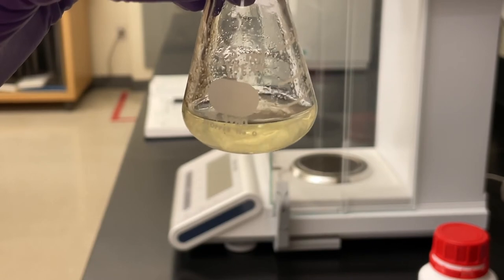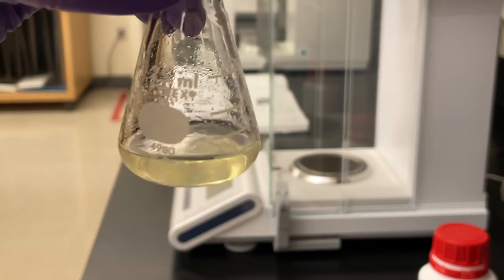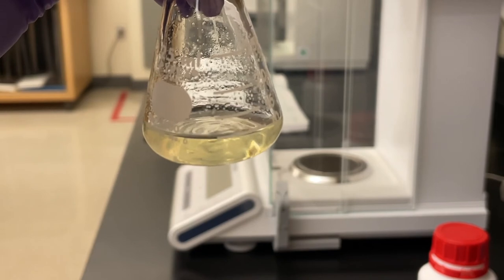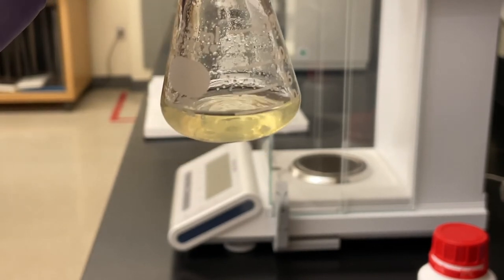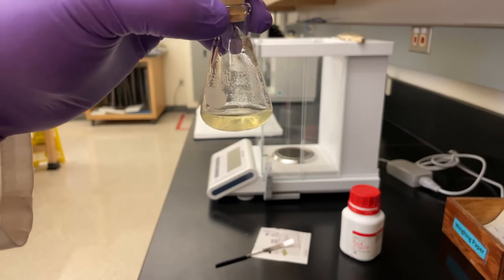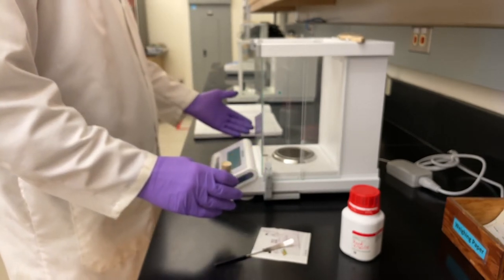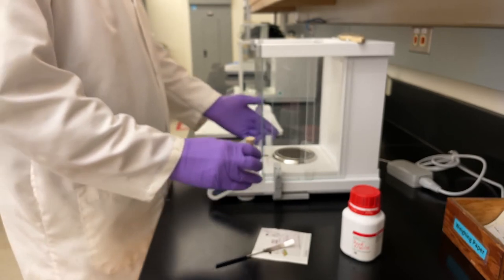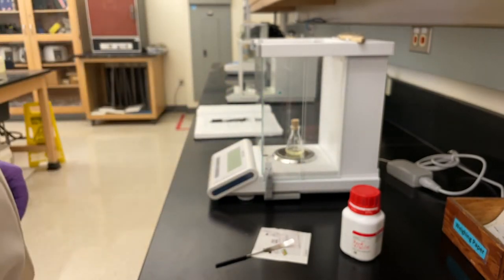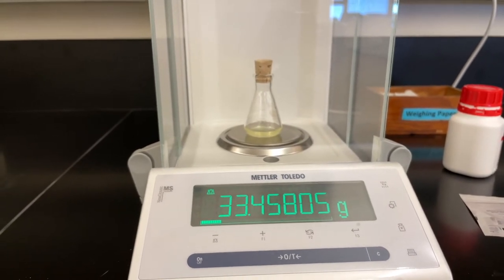We're back at the balance. I'll give you a quick shot of what the material looks like — there's a little solid settling on the sides of the flask, but that should be okay. We're going to get our tare weight on this, then get back over and add the benzaldehyde to get the reaction going. I want to make sure the balance is zeroed first. Good to go.